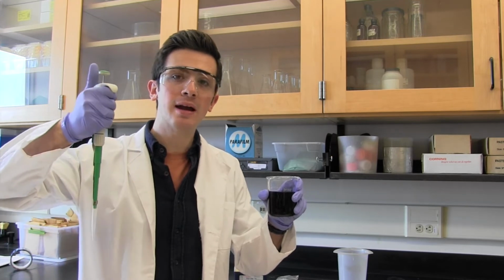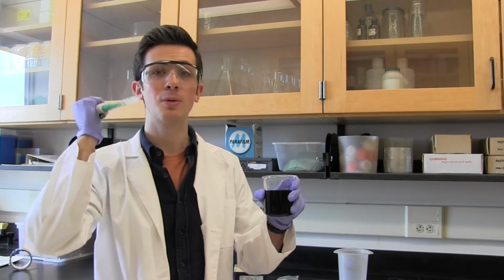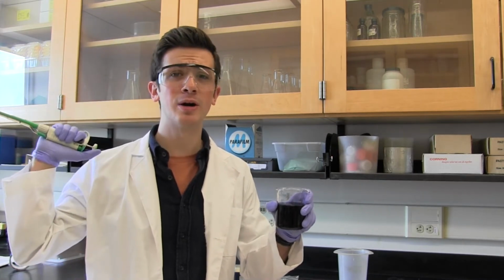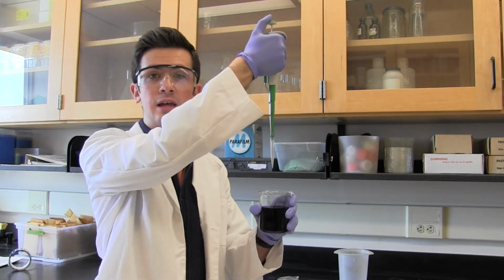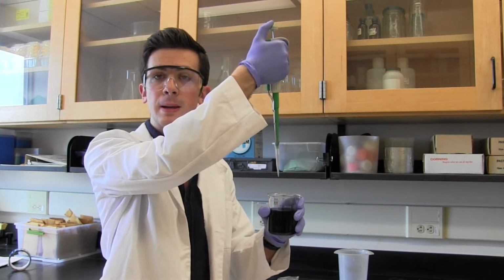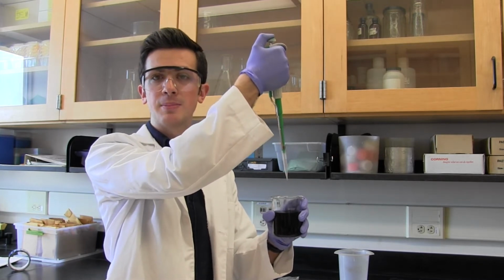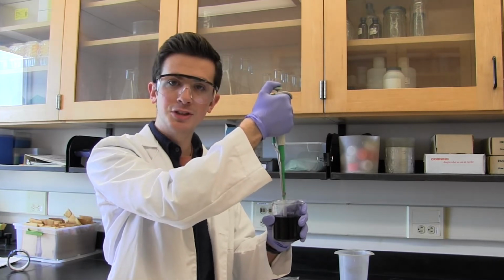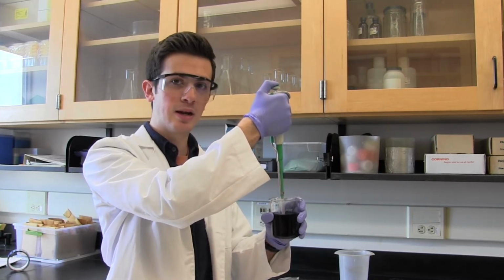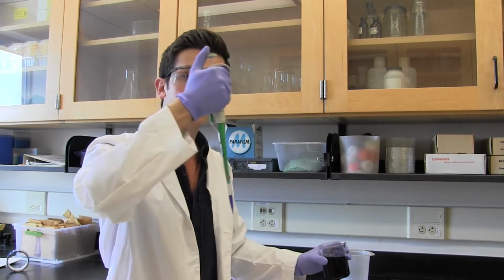Then, taking your pipette, hold it vertically, not horizontally or laterally or upside down. I have no idea why you'd hold it upside down, but I've seen some weird things in lab, let me tell you. You're going to want to insert it into the solution. Before we do, however, make sure to depress the plunger to the first stop. Doing so prepares the pipette to pick up the solution or volume of liquid. Slowly but surely, insert the pipette into the liquid and then release the plunger slowly. This picks up the liquid, sucking it into the pipette mechanism.